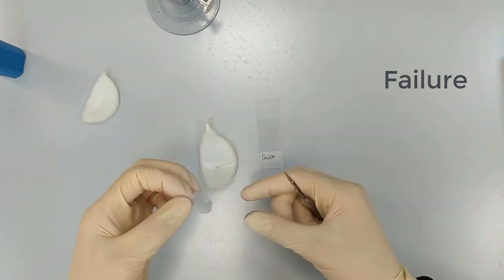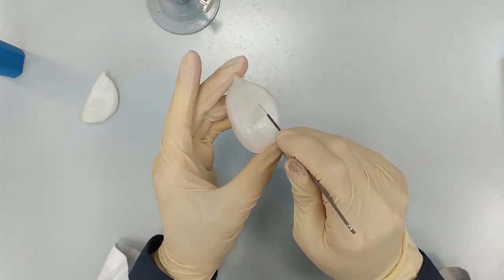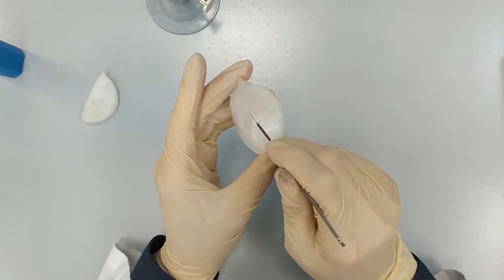And from here, you take this small part and peel it out.